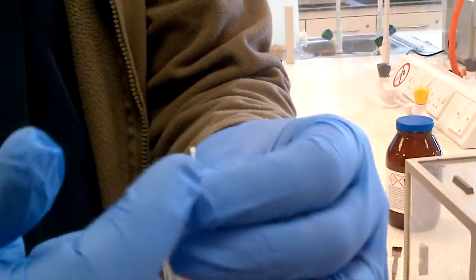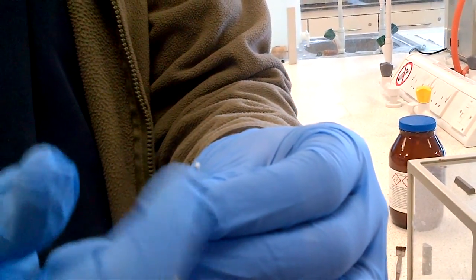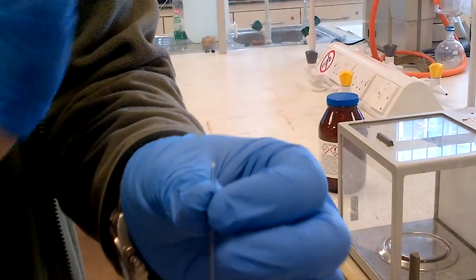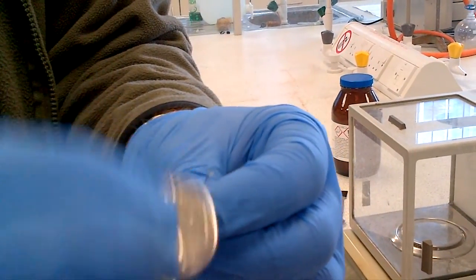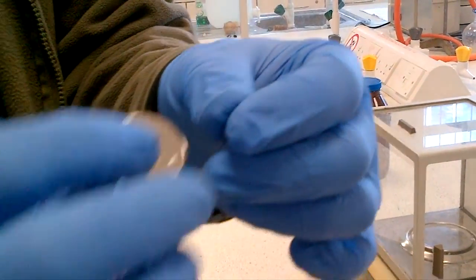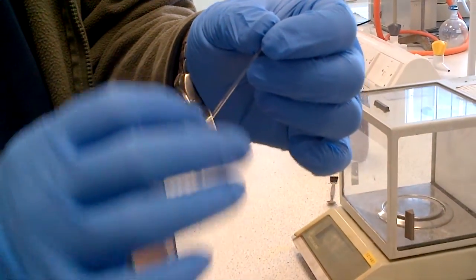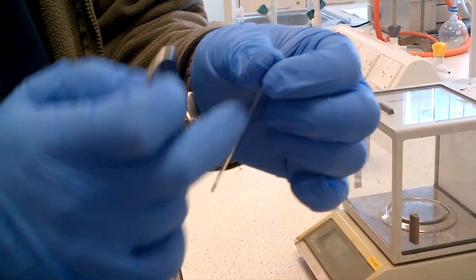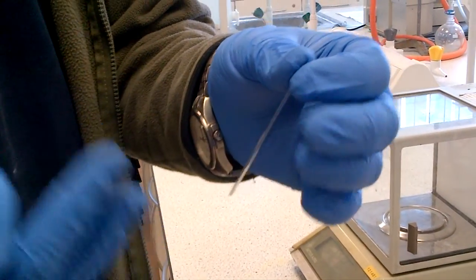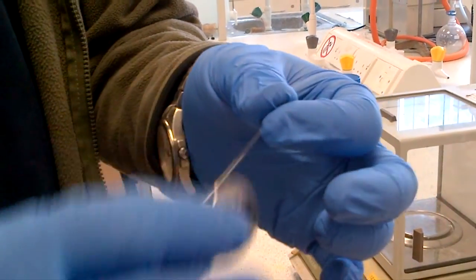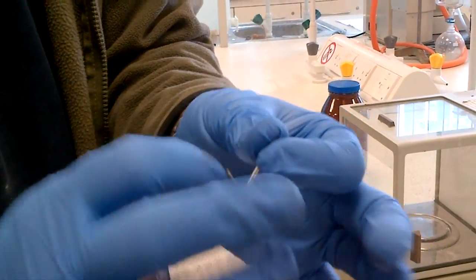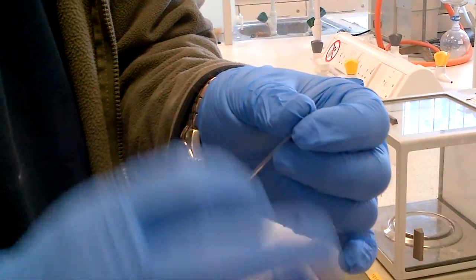And then to get it down, you can either flick it and some will drop down, but if the sample is a bit gloopy or moist, if it's moist it should be in the oven for longer to dry as a pre-dry, but you can brush down with a coin, a jagged edged coin. If the sample doesn't want to travel down, it's possible because it's wet and it needs to go back in the oven for a longer amount of time, or it's not a good crystalline structure, so I suggest a recrystallization might be appropriate.